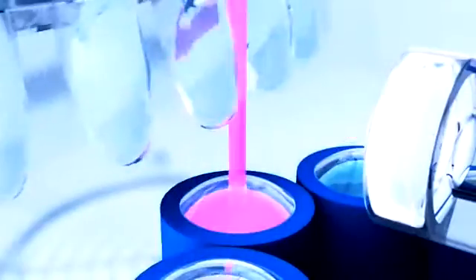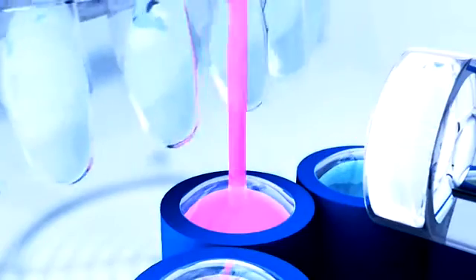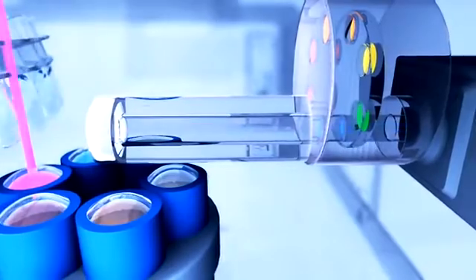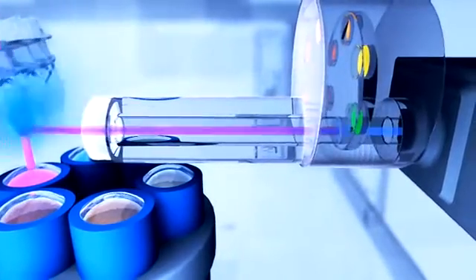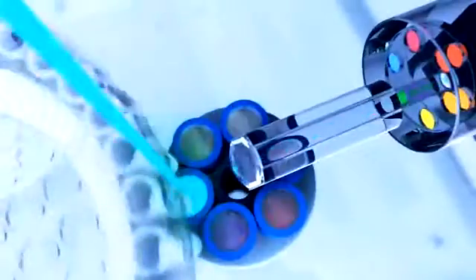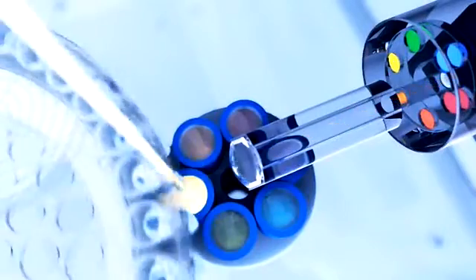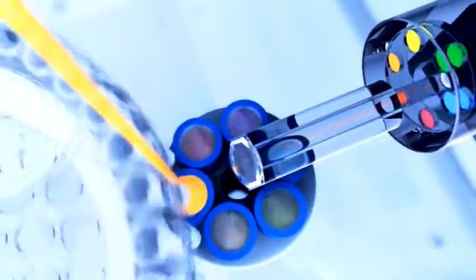Up to six individual optical channels provide maximum flexibility in the choice of fluorophores. Sample-to-sample variations and edge effects, typical for block-based instruments, are completely eliminated.